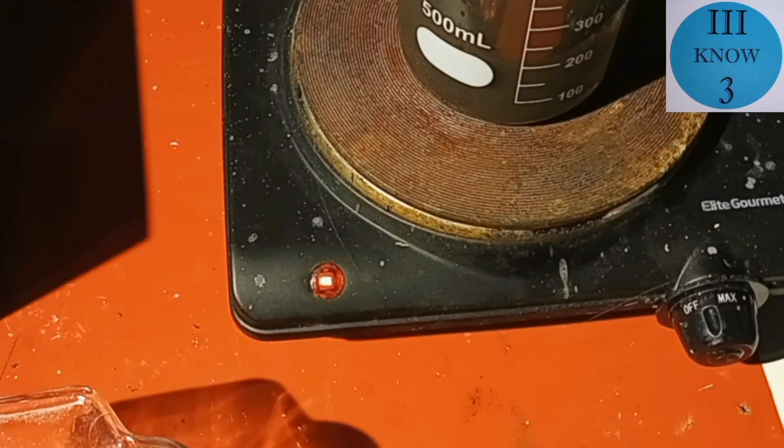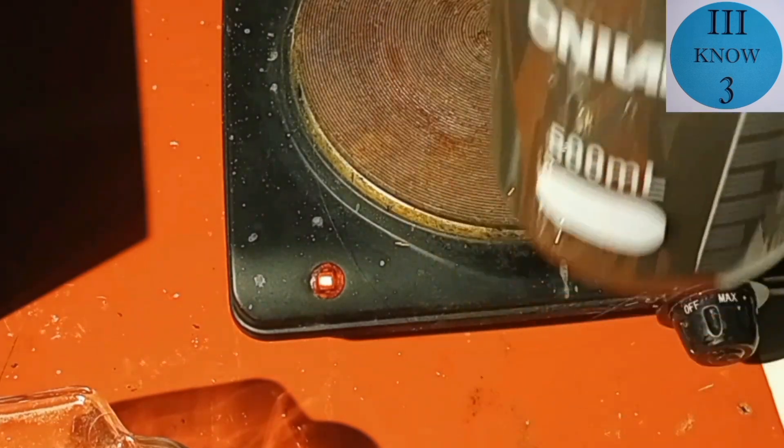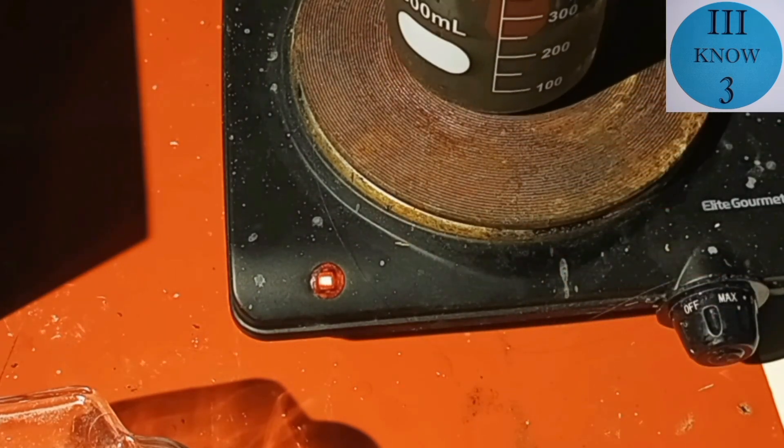So we're gonna put it back on the super scientific hot plate over high heat and see if maybe boiling it for a little while will help some of that settle out.